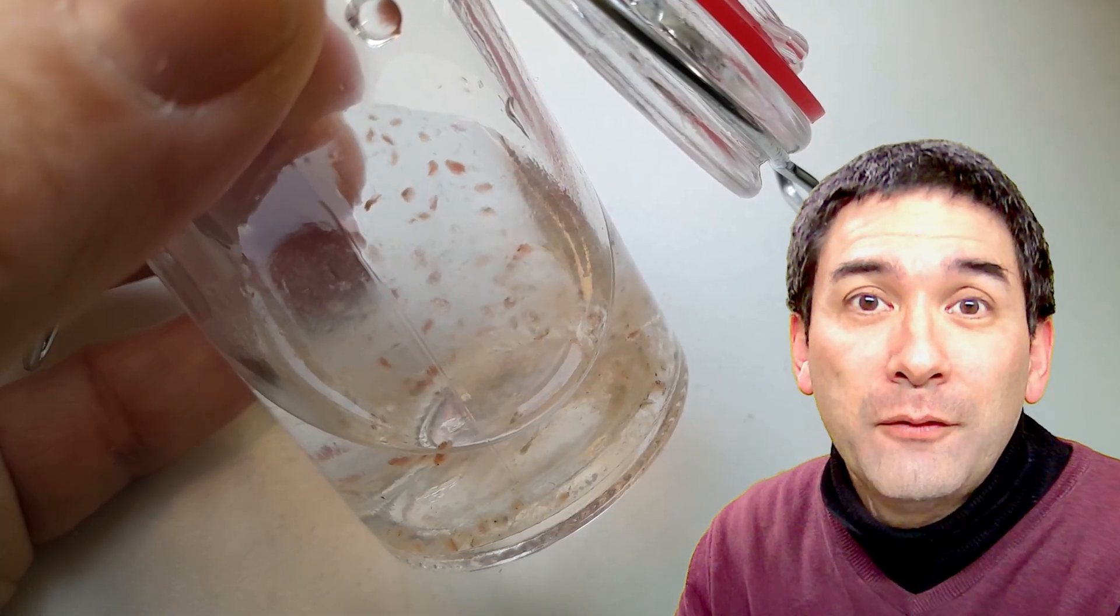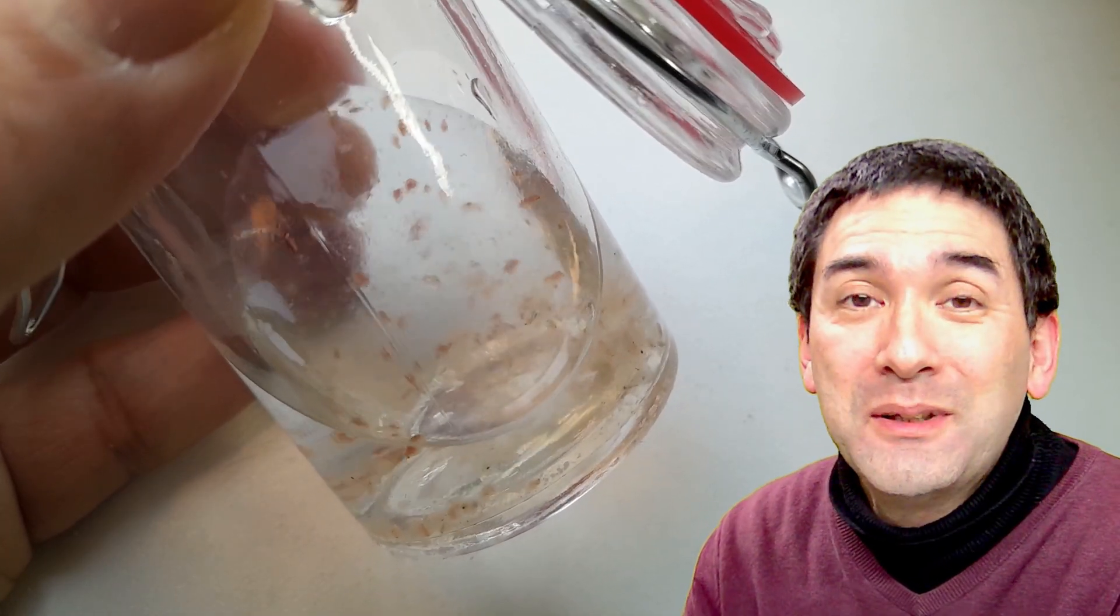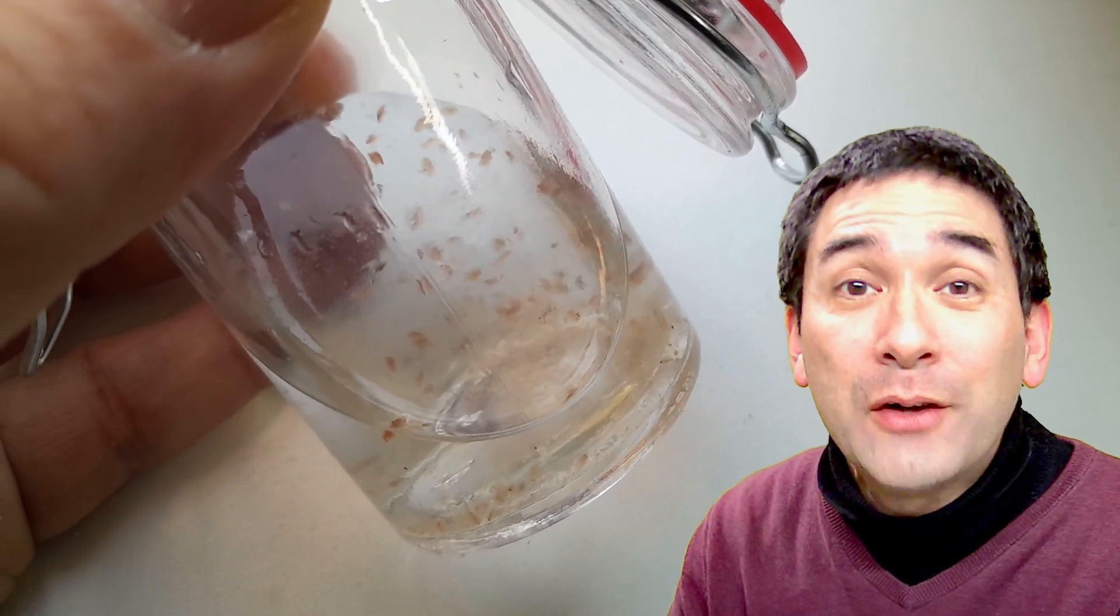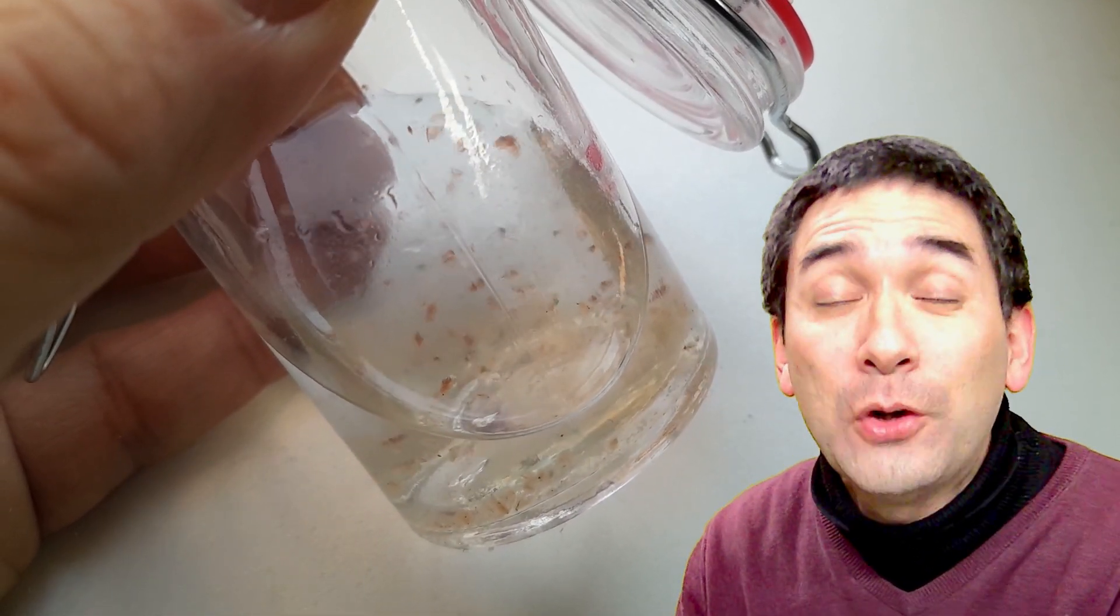And I got a few hundred of them here. I kept them in the little jar over here and they're happily swimming around reproducing. Some of them are indeed also pregnant.